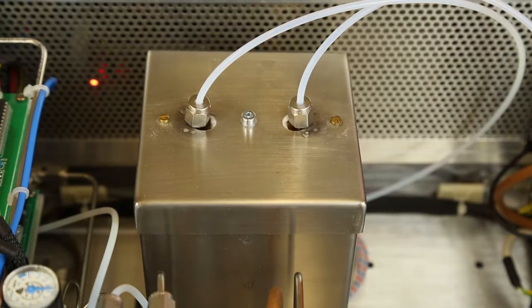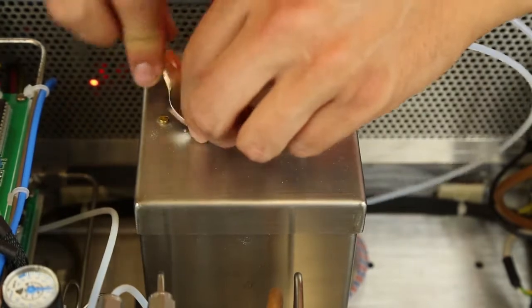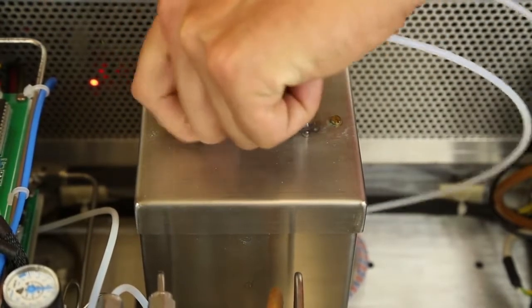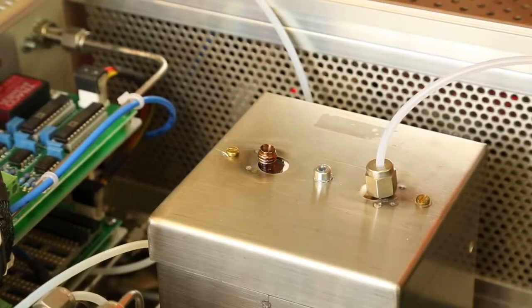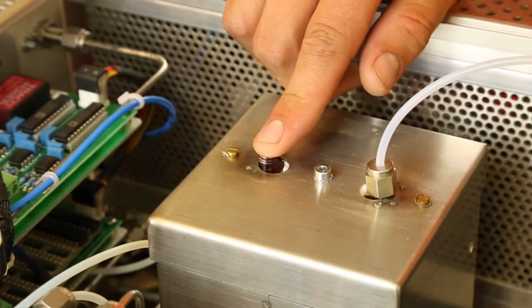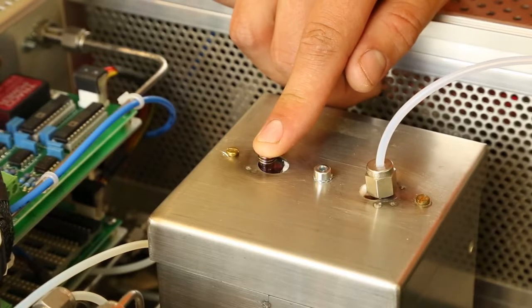Identify the column to be regenerated and locate the output on the gas flow drawings. Disconnect the output with an 11 mm wrench. Wait for a minute and with your finger, check the gas flow in the column. You should feel a slight pressure on your finger.